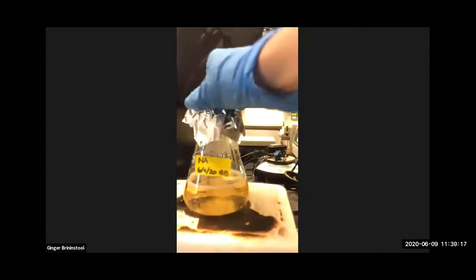where the autoclaves are. All right, so this is the media prep facility, the other part. I'm gonna back this up for a second and show you what an autoclave is. This is a more modern one, if you will. You can see it's got a touchpad right there to work with. I don't like that one, but it's open. You can see that there's a chamber inside. It's nice and cozy. When in use, this door goes up and closes.